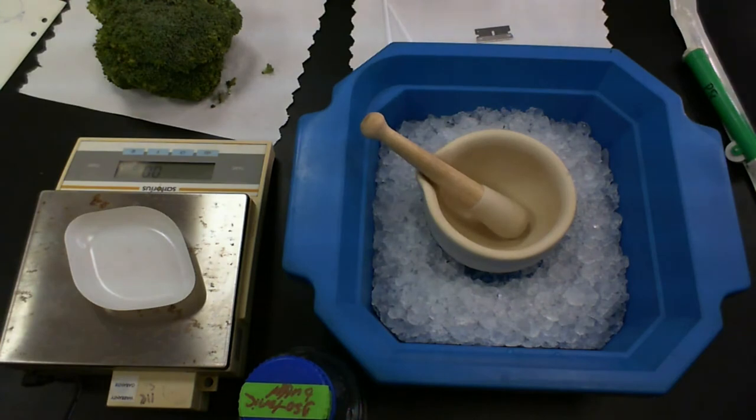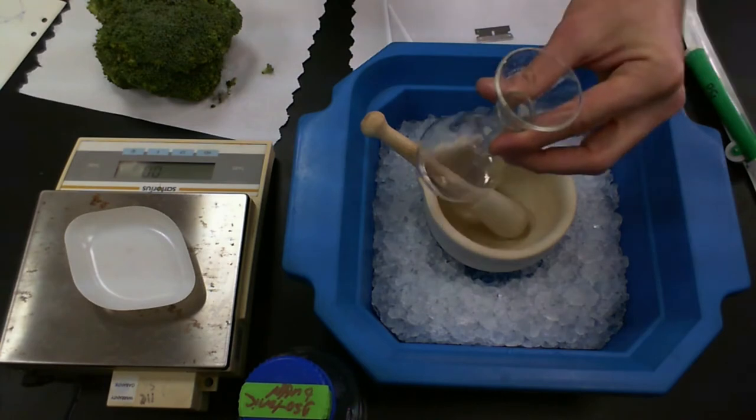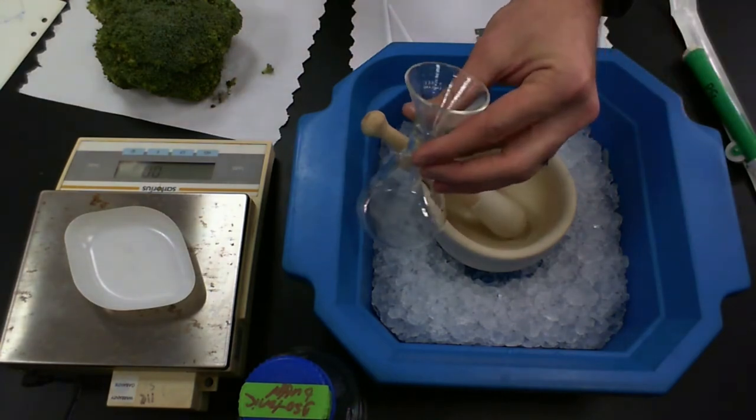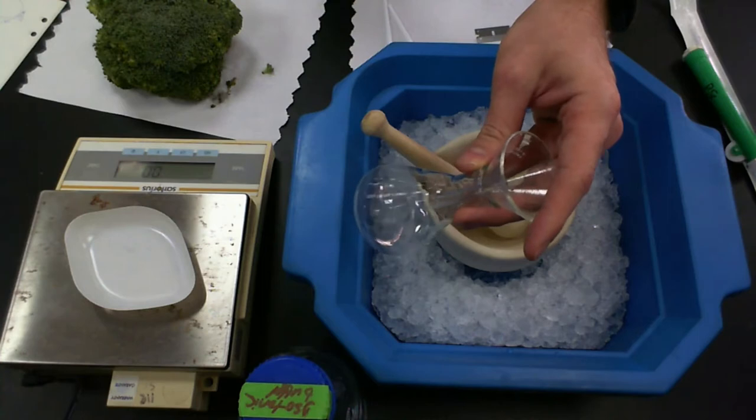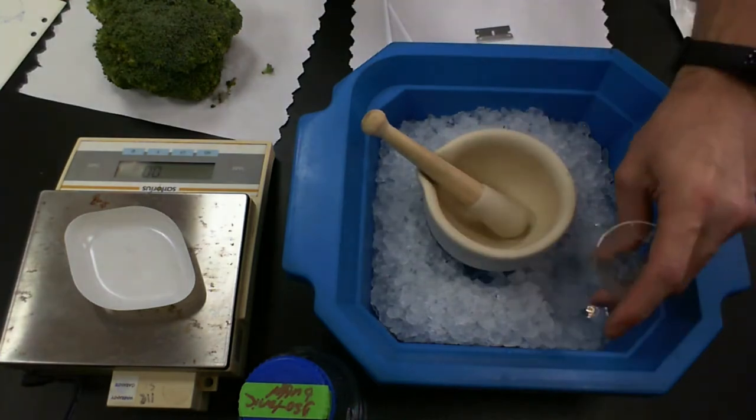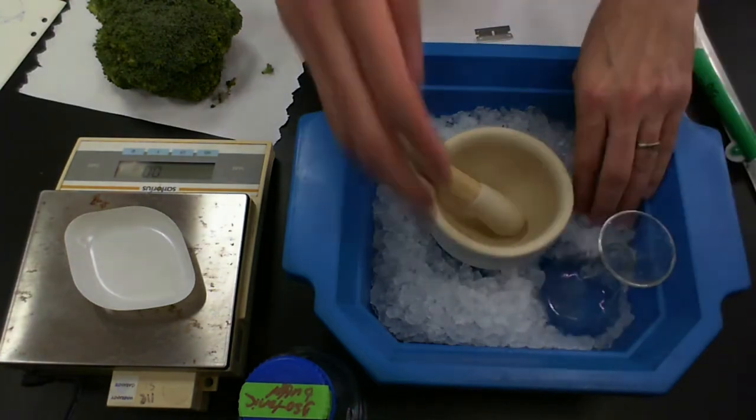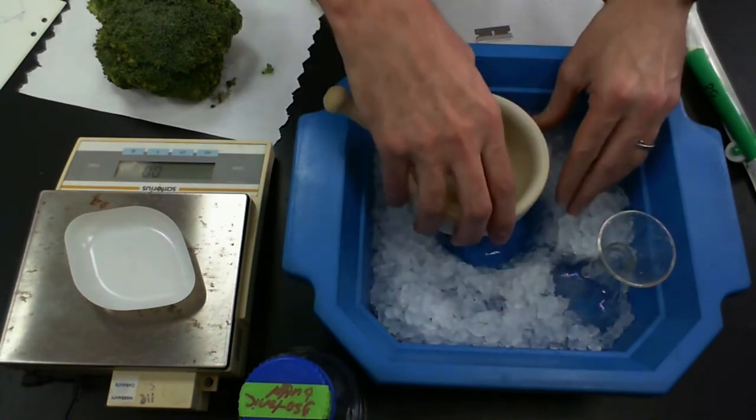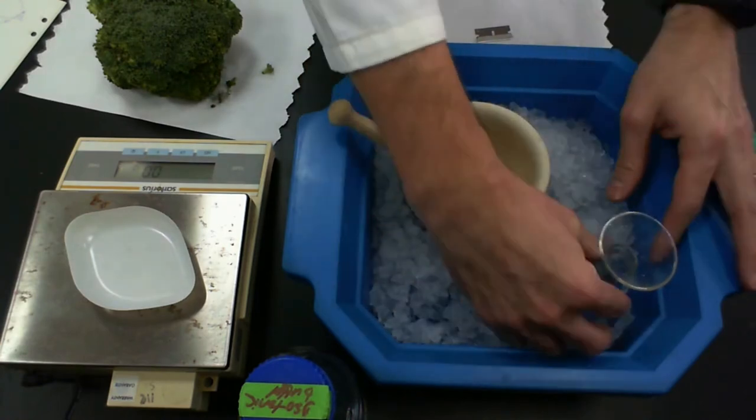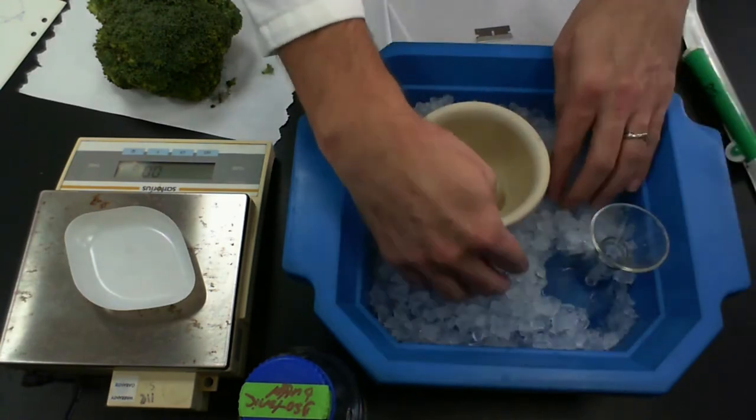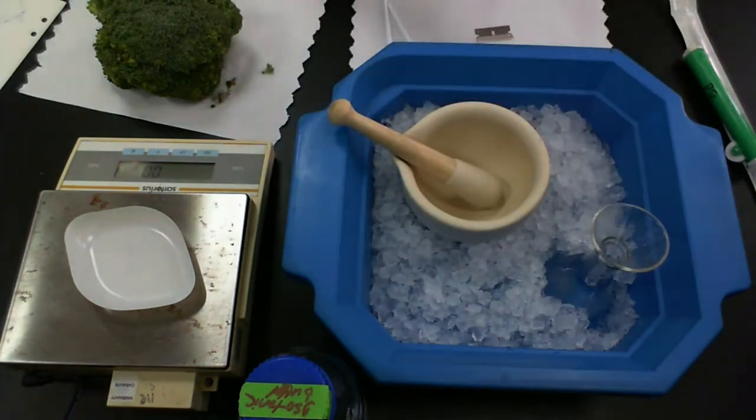I will also place a funnel and flask inside the ice as well, just to make sure it's nice and cold, so when I'm adding my sample to them, they're going into a nice cold sort of space, so that minimizes enzymatic reactions.